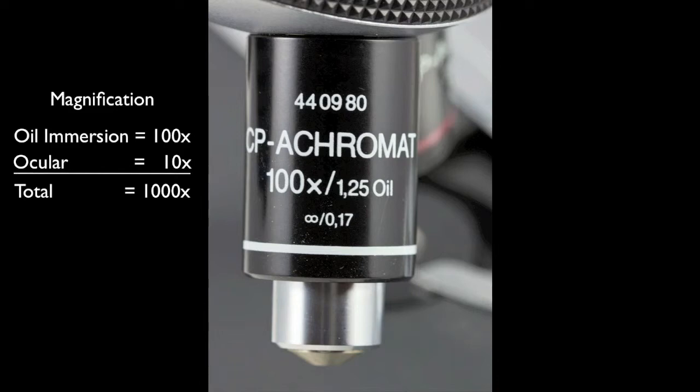We will only use this lens to observe bacteria. As the name suggests, you must put a drop of oil onto the slide before rotating this lens into place, and the tip will indeed dip into the oil.